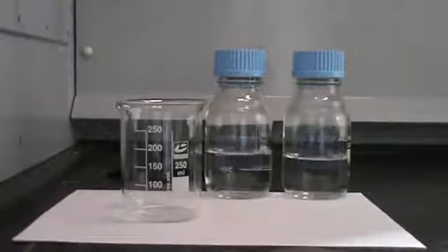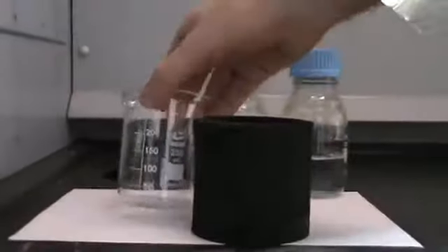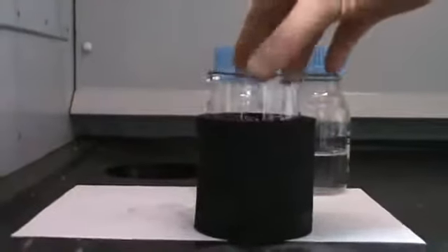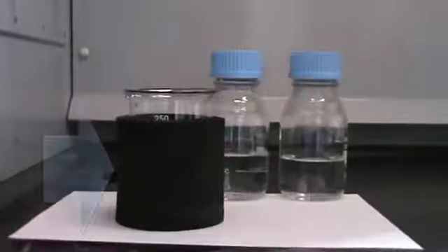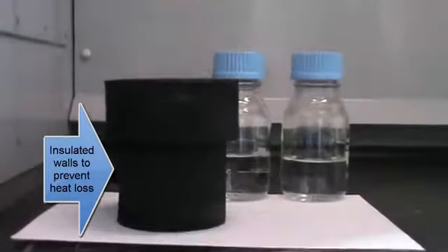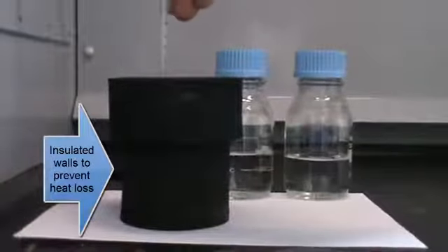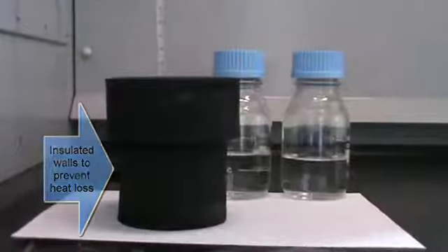To do this we'll use a calorimeter, and this is something that we'll place the beaker into so that it insulates the walls of the beaker. In other words, as the reaction is proceeding and giving off heat, the heat that's given off won't be able to leave the calorimeter. We'll measure the increase in temperature in the reaction using a thermometer placed in the calorimeter.